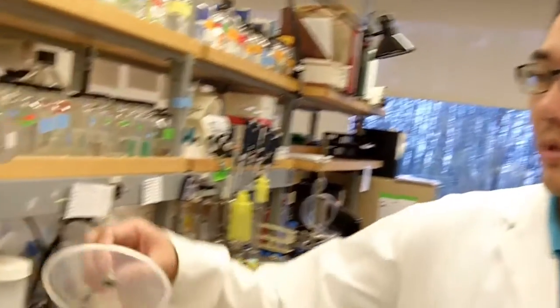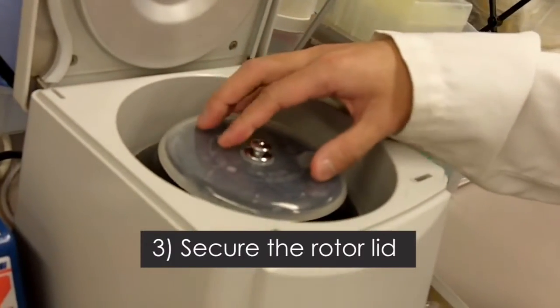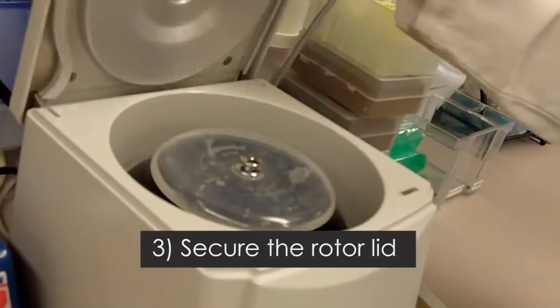The third thing you need to do when you use a centrifuge is that you always have to secure the rotor lid onto the rotor, like that. Make sure it's secured, then you can close the centrifuge.